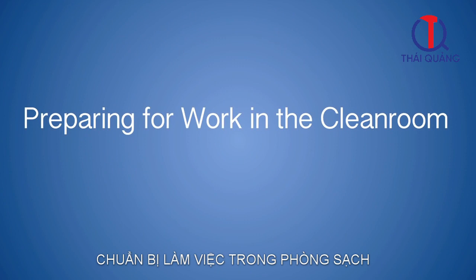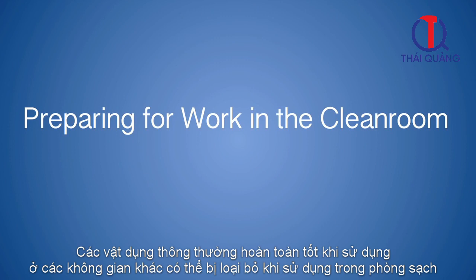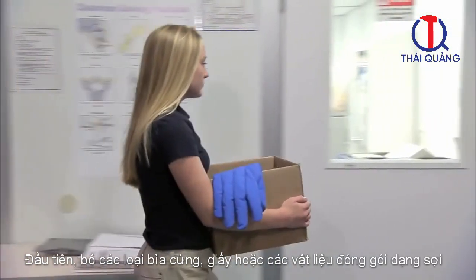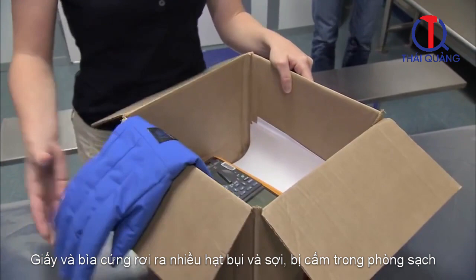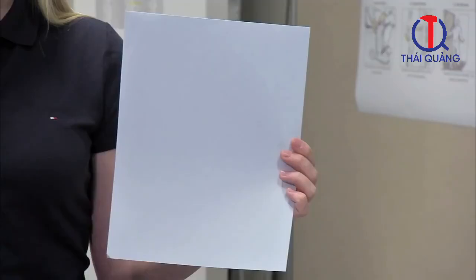Preparing for work in the clean room. A clean room is not an office or a general lab area. Certain items that are perfectly fine in other areas are prohibited in clean rooms. We have to properly prepare before gowning up and entering the clean area. First, remove any cardboard, paper, or other fibrous outer packaging from items. Paper and cardboard excessively shed particles, and fibers are prohibited in clean rooms.